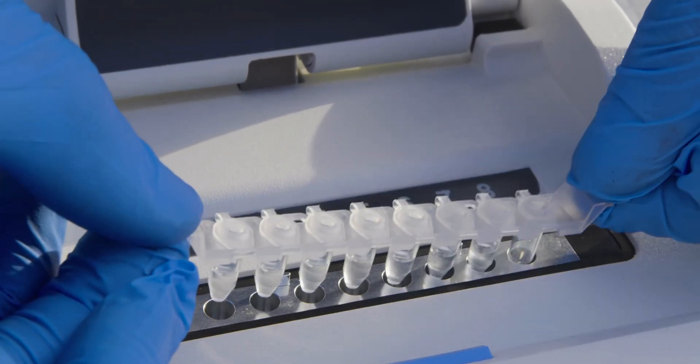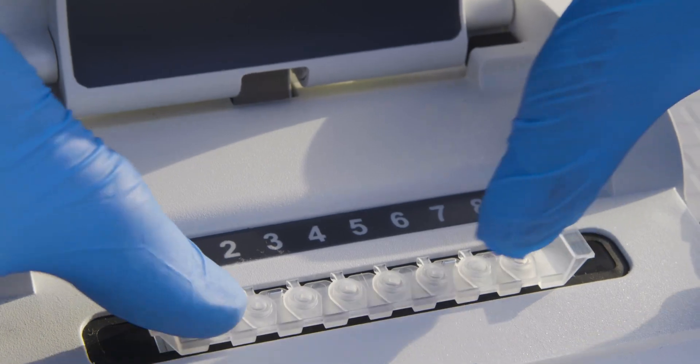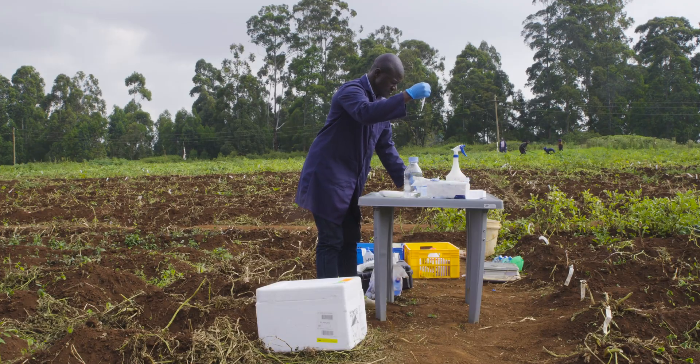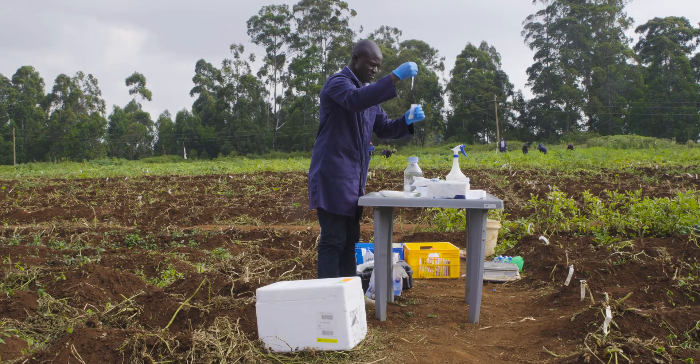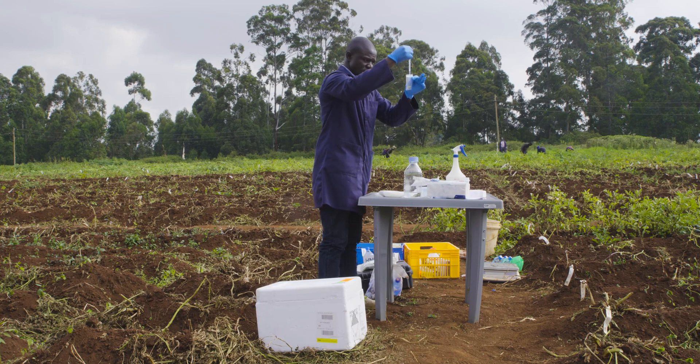Now let's go through the different steps to run a lamp assay diagnostic test. Set up in a location protected from the wind, which can move aerosols amongst samples and contaminate them.